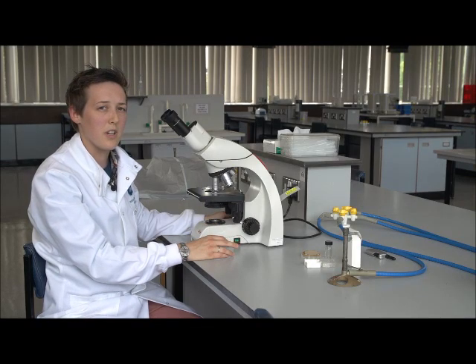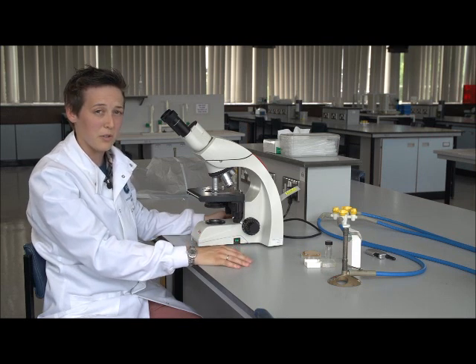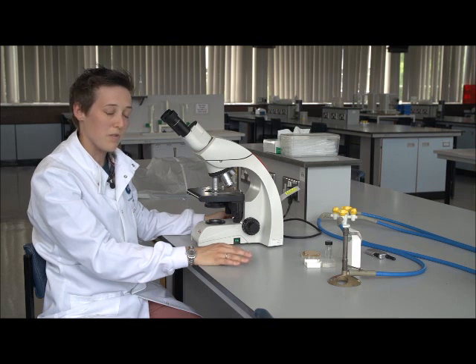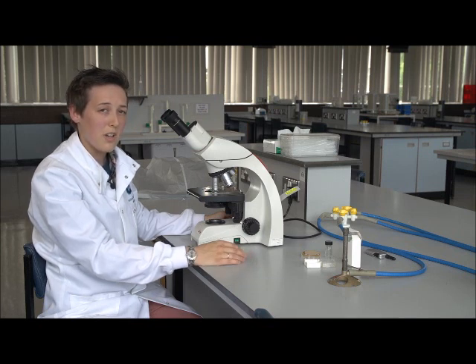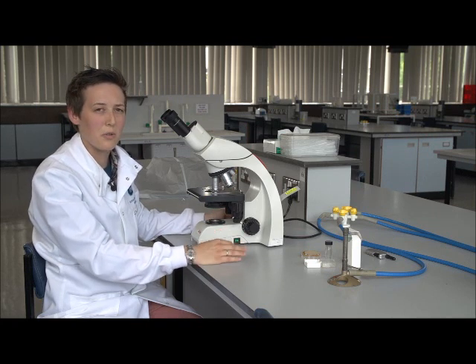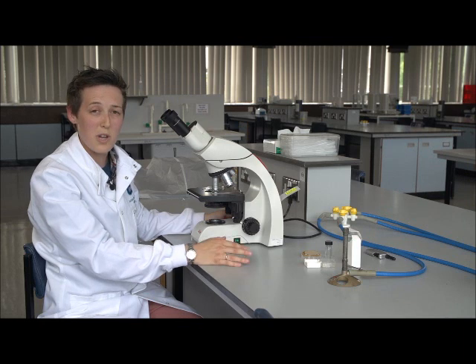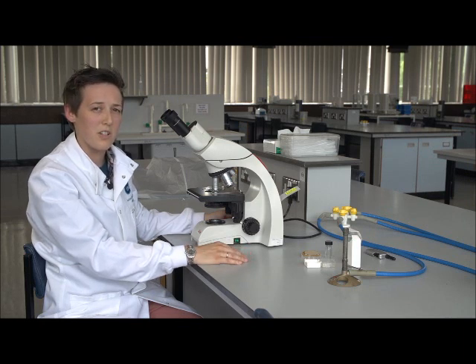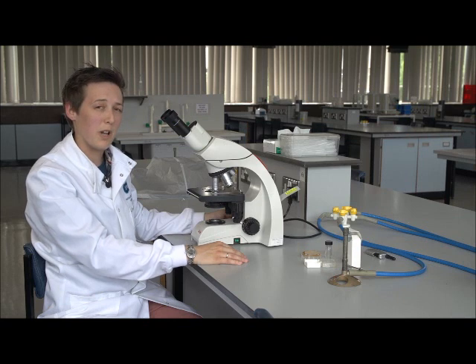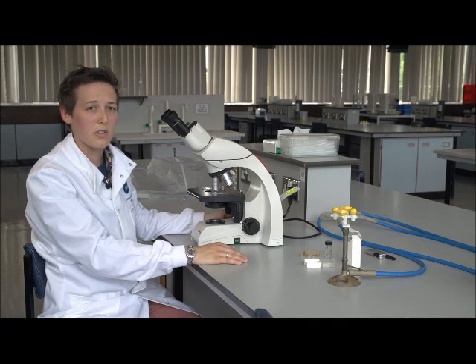Now, phase contrast is a technique which allows us to see transparent cells. So most living cells are transparent and have no colour. The very good advantage of phase contrast is that we can see living cells. So we don't need to fix or kill our cells or stain them before we visualise them. And phase contrast is actually used in some of the research labs in the university, such as the May lab, where we can look at macrophages and pathogenic fungus, and we can do time-lapse imaging overnight on microscopes. And that's because phase contrast allows us to look at living cells for long periods of time.